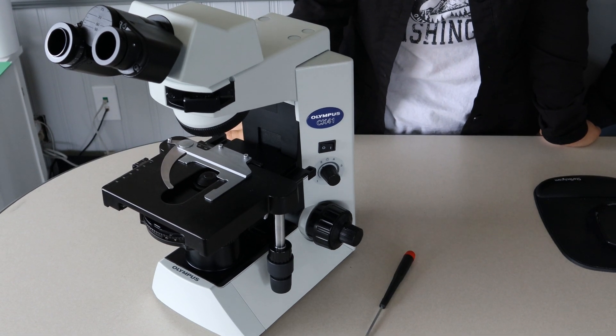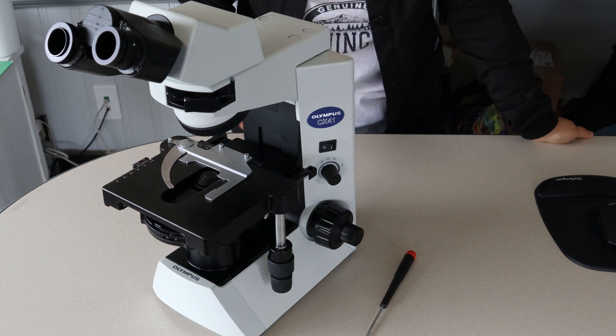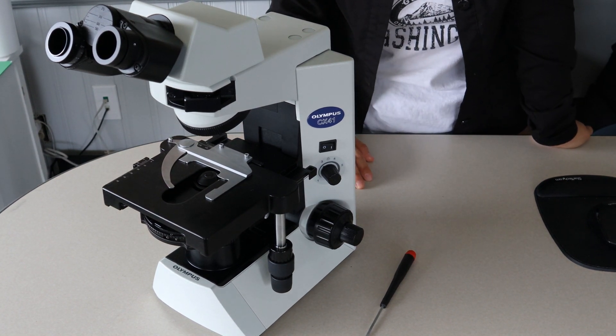Hi, this is Walker from the Scientific Instrument Service, and today Maria and I are going to be going through and showing you how to adjust the tension on the focus on your Olympus CX series microscope.